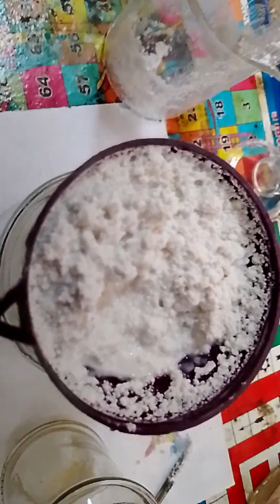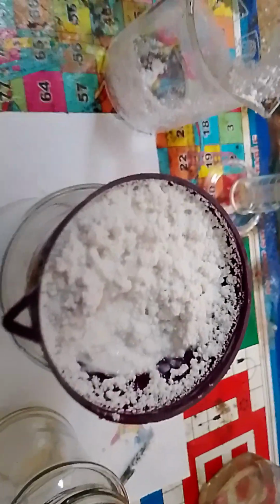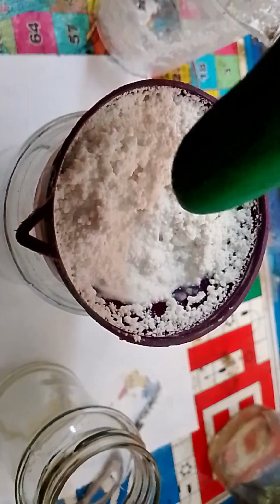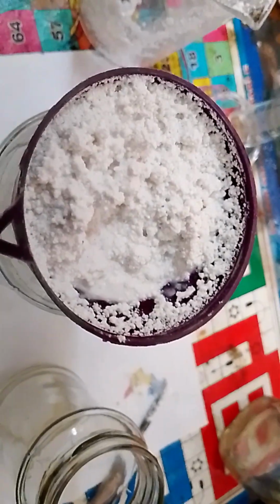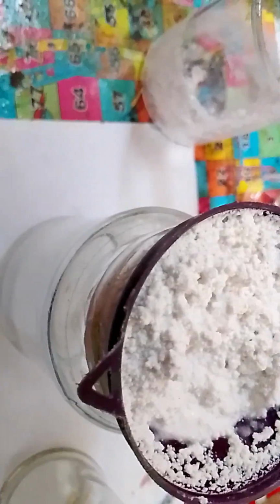Yes, chlorine is bubbling out, which means the reaction is occurring and it is reacting with the water and a little bit of sodium hydroxide. But at the bottom layer, if you want to see, you can see a little thick syrupy liquid. I mean, not liquid, solid. That is the calcium carbonate with a little bit of hydroxide. The solution is milky, but we will do a quick refiltration.